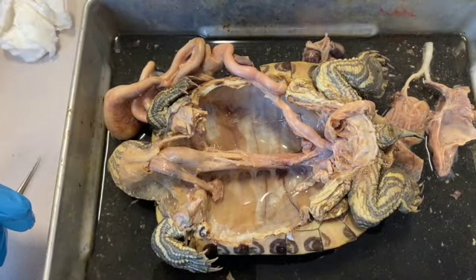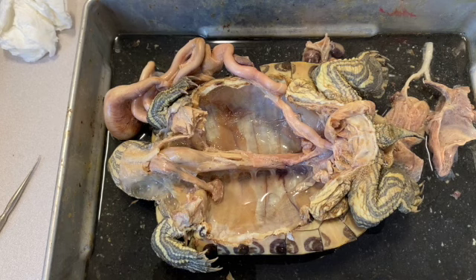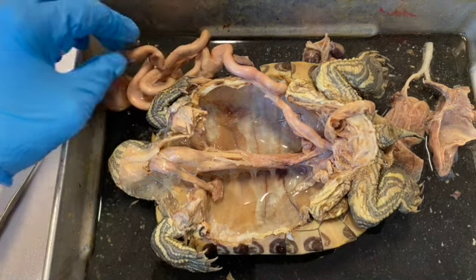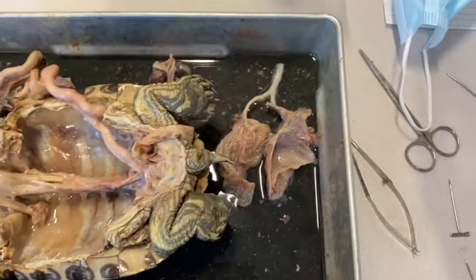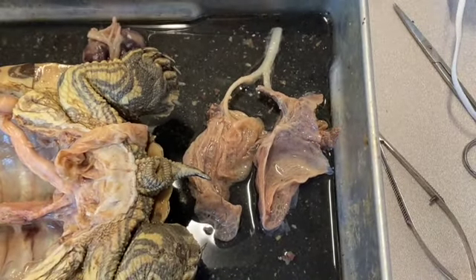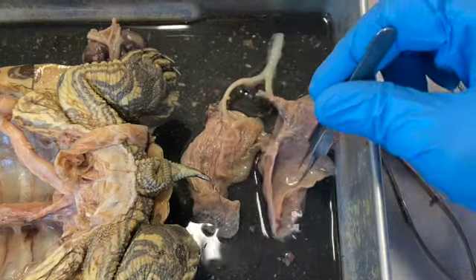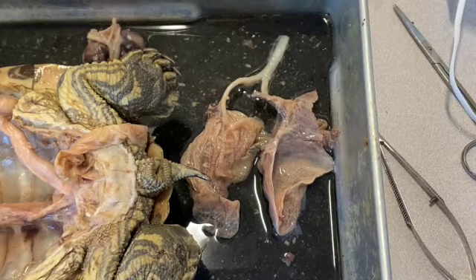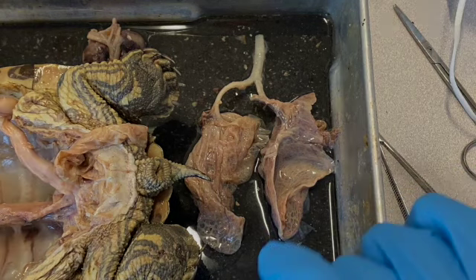All right, you can see that some rather drastic changes have taken place. I've removed all the organs of the abdominal cavity and moved them aside. The heart and the pericardial cavity has been removed, as have the lungs. So let's just take a look at the lungs for a second. Here you can see the trachea, and then these large structures are the lungs. They have a surprising volume in them. But anyway, I just wanted you to be able to see that.